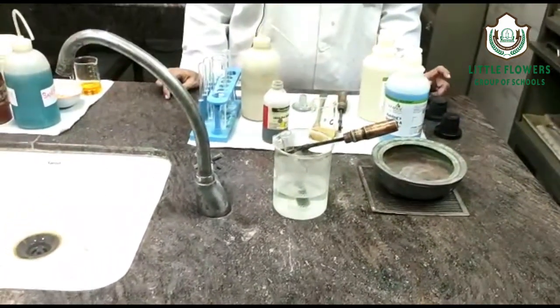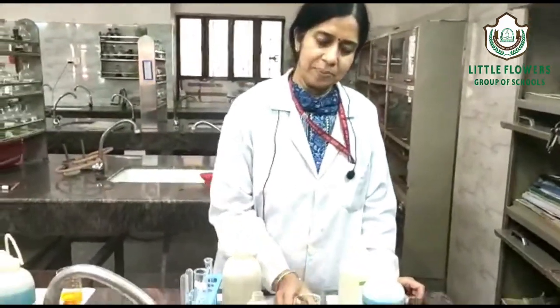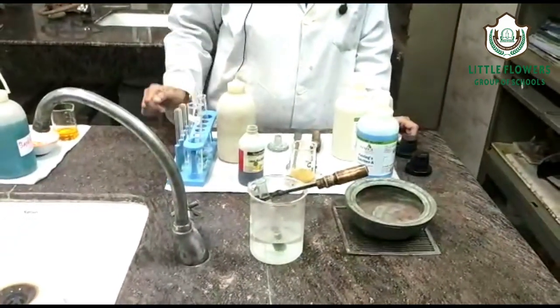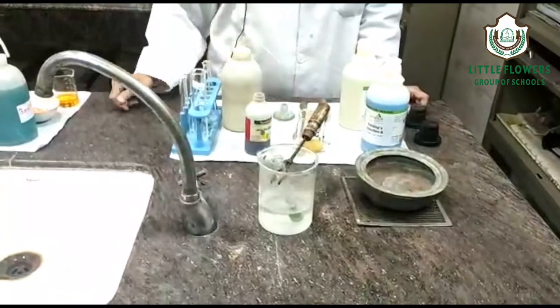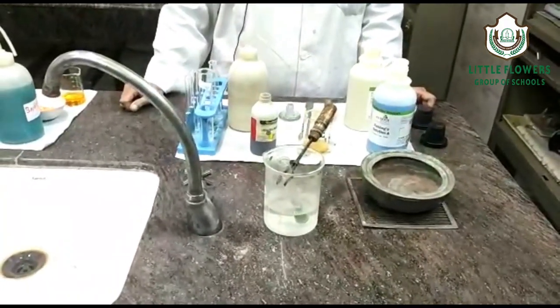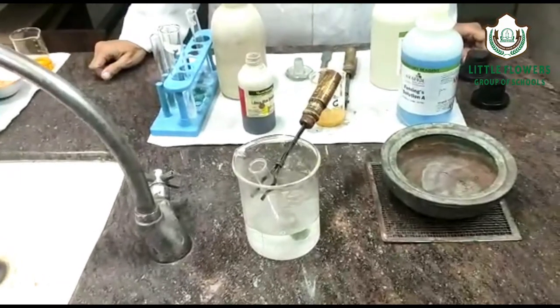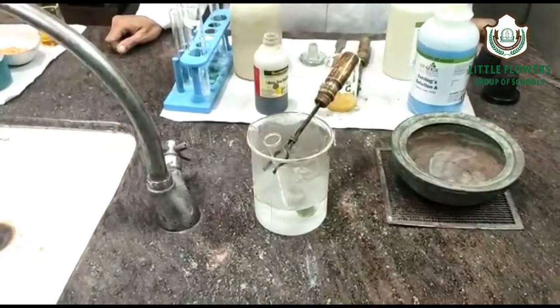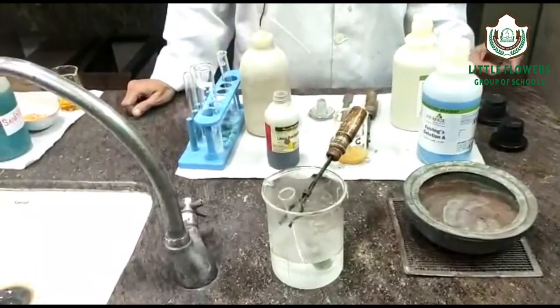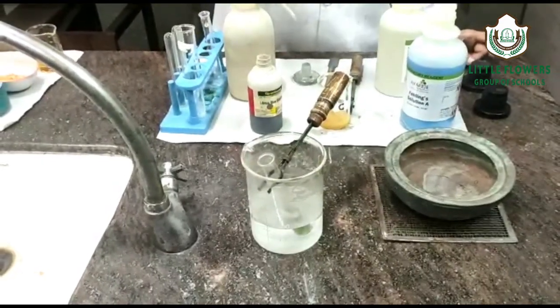The moment the reddish-orange color appears, it will confirm that in the given organic compound the aldehyde functional group is present. Now the test is completed. It may take a few more minutes, and when it is completed I will show one more video to you. Thank you.